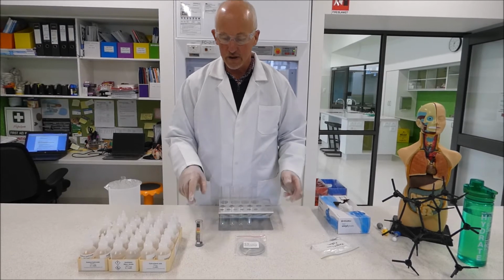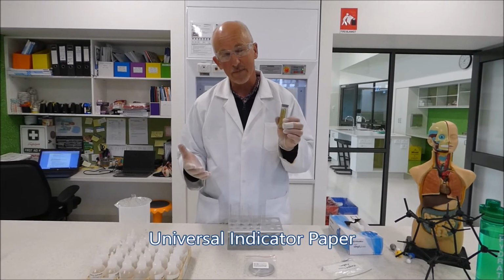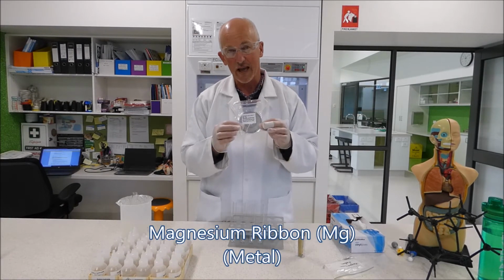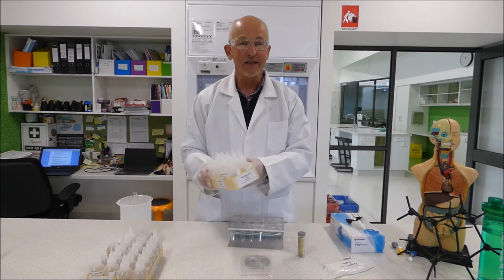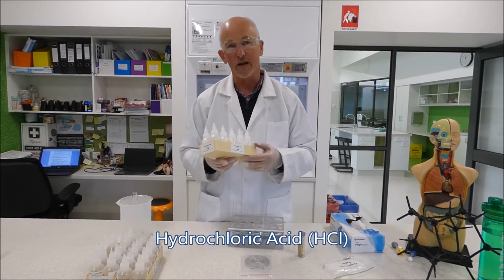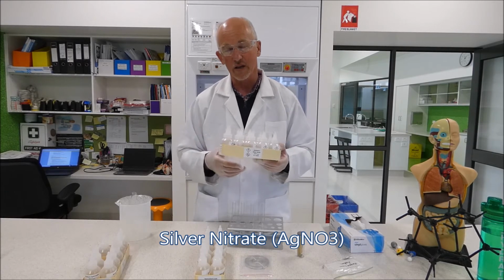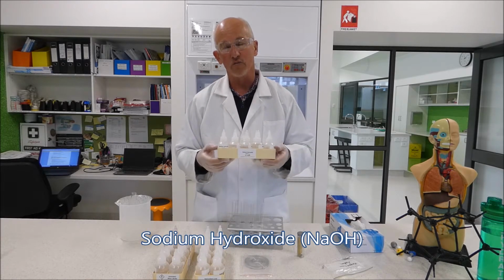We're going to need some chemicals and some test paper. So the first thing is going to be some universal indicator paper, which is going to be used instead of the litmus paper that you might have used originally to observe a colour change. We're going to need some magnesium ribbon. Now magnesium ribbon is just a magnesium metal, so we're going to react that with an acid. So obviously we're going to need some hydrochloric acid. Hydrochloric acid is going to be used in a couple of our other experiments or other reactions as well. We're going to need some silver nitrate, which will create a precipitation reaction with the hydrochloric acid. And we're going to need sodium hydroxide to do a neutralization reaction with the hydrochloric acid.